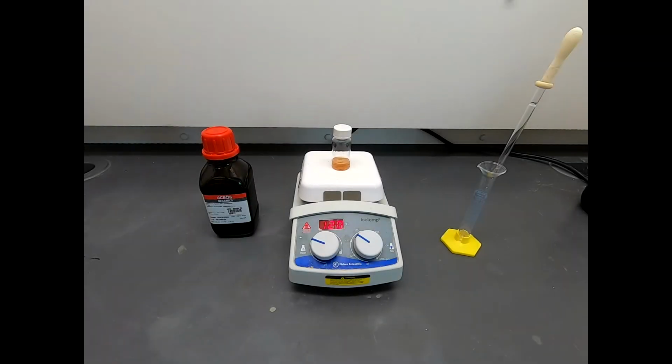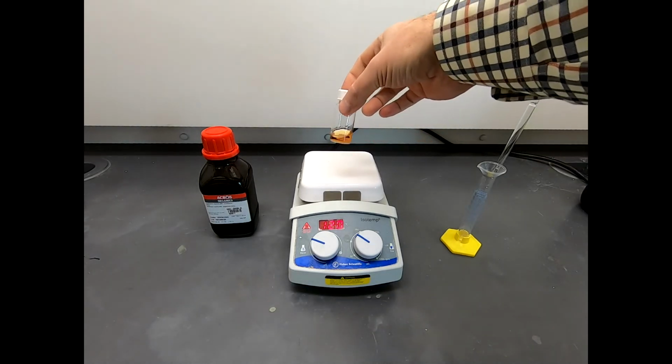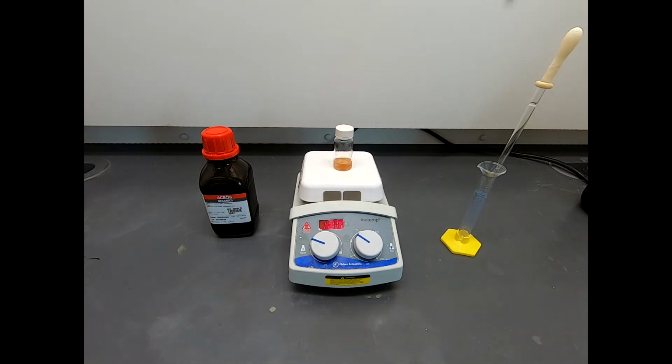Well, here we are where we left off. We've heated this for about an hour. You can see there's some color change here. It's got a little bit of an orange color to it. I didn't point this out, but when we cut off from the video previously, you can scroll back to see this, you'll see the reaction was starting to yellow just a little bit, even in the short time that we saw it react at the very start. So this color change has been progressing a little bit.